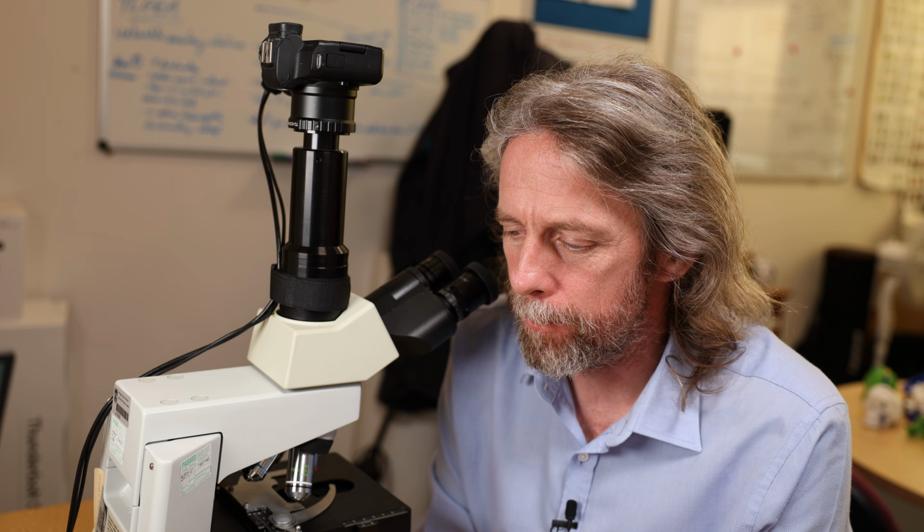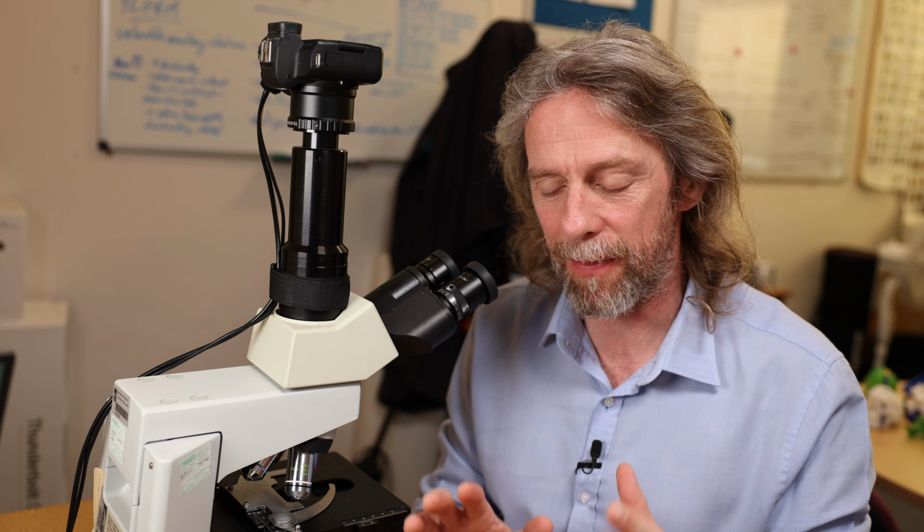Hi, so you want to look at the histology of the cerebrum, the most complicated thing in the human body. It's actually not that bad under the microscope. We looked at the spinal cord last week. Similar principles. We're going to look for grey matter and white matter and see how they're different.